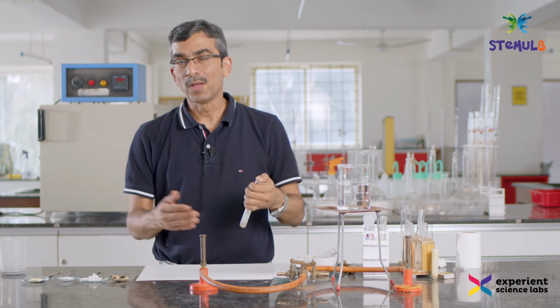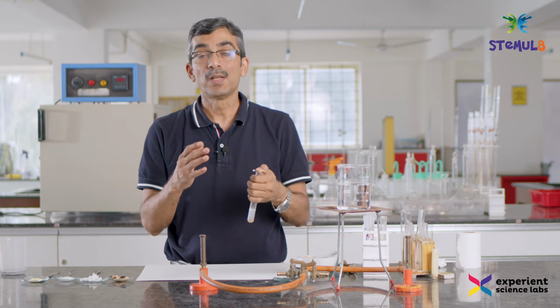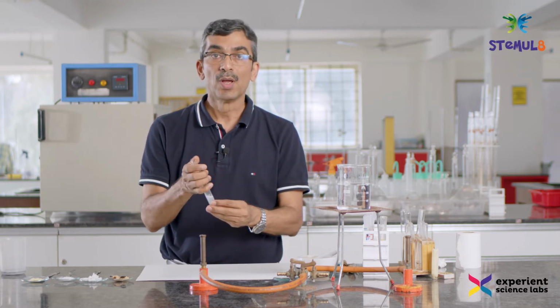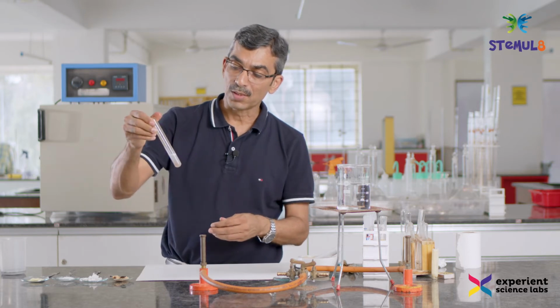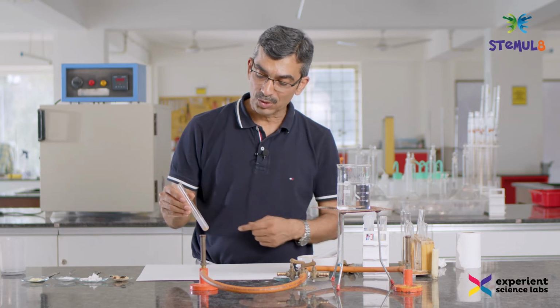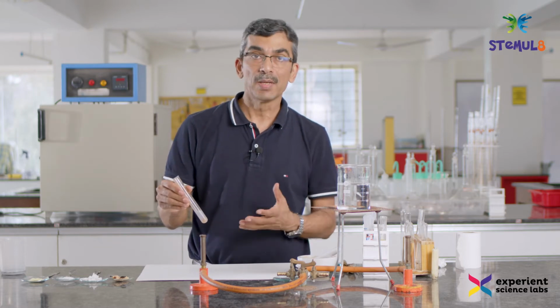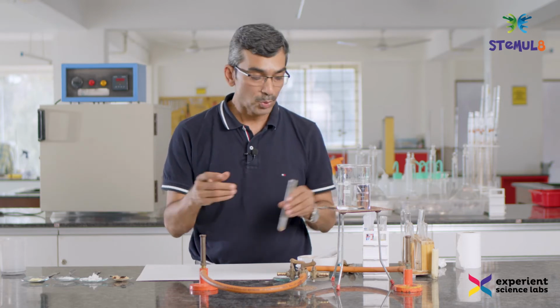The reason why we are able to do the test in a very simplistic way is because we are not interested in finding the quantum of protein in it. So we are not very fussy about the measurements. Otherwise, you would have to do it in a very measured and very systematic manner. When I added biuret reagent, the color of the solution turned a bit purplish bluish. It's not exactly purple, but if I heat it up a bit, then probably the reaction will occur and the color will change to an even darker purple. So let me do that.